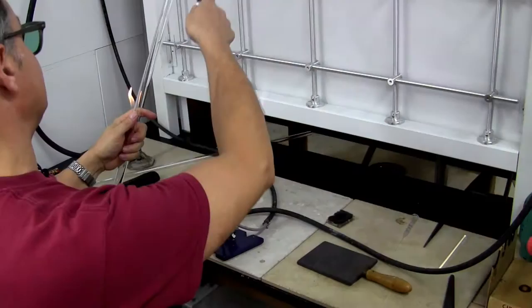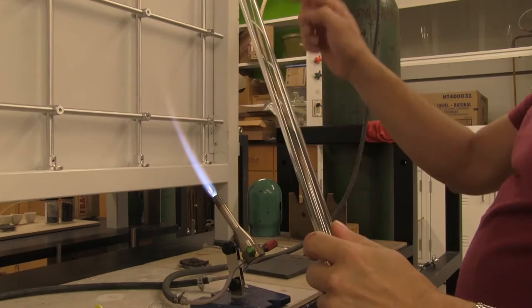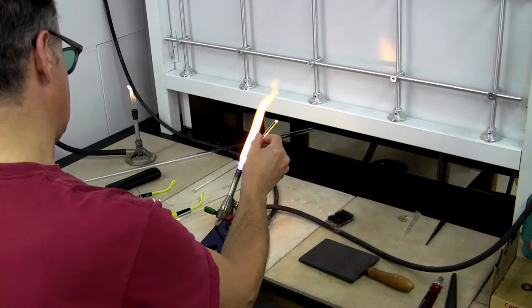You take a piece of glass pipe about one foot long and score it with a tungsten carbide knife. Then you need to moisturize that area to provide the heat shock. You take a glass rod.